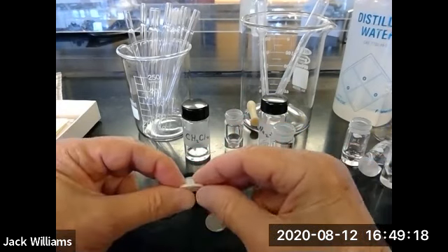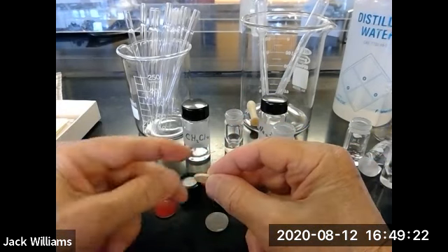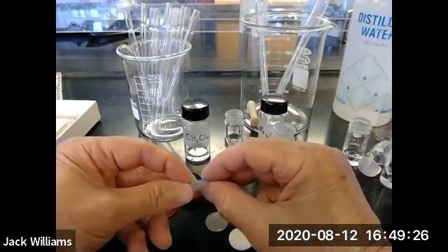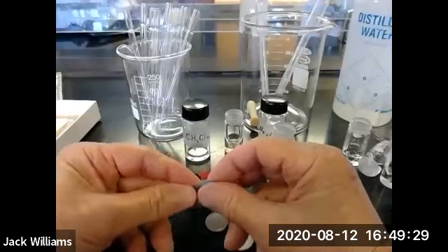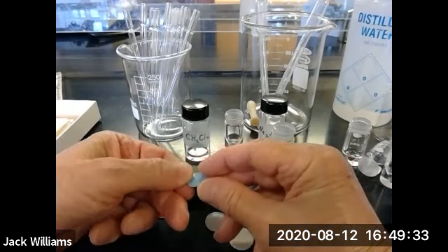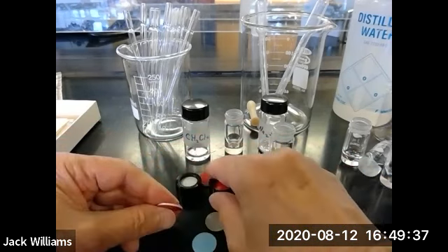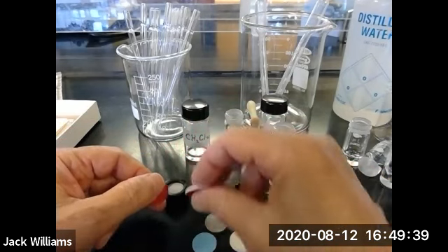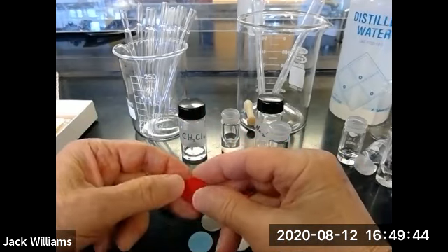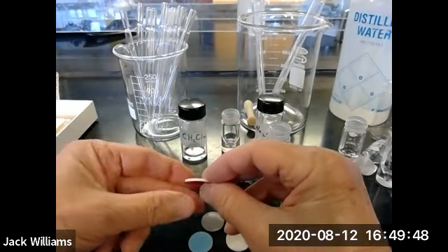Let's take a look at this one. Sidewise, there's the Teflon. That's going to face down. But this one over here is easy because I can see this one. Guarantee this is the Teflon side that faces down. There's another one. So you can always tell this. In this case, there's the Teflon, and that's the one that faces down.